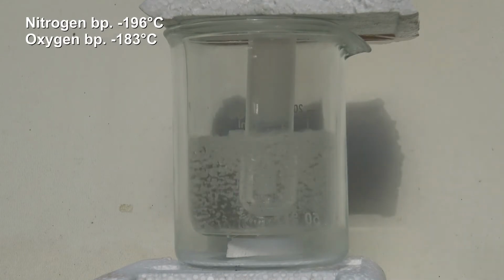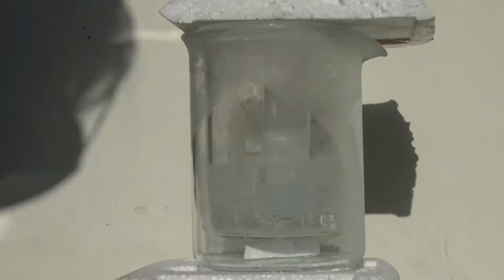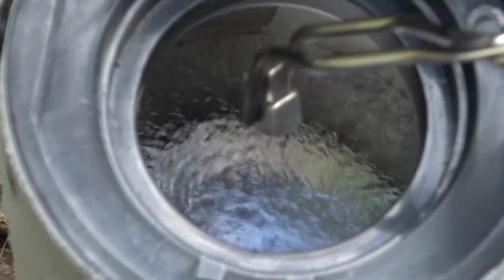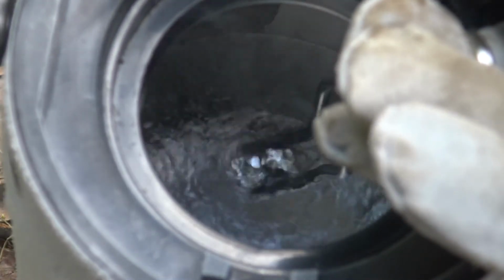To remove ice from the surface of the beakers, it was covered with some ethanol. Liquid oxygen has a pale blue color, which can be seen better when the prepared oxygen is dried before the condensation, as it can be seen here. In the meantime, 2 strong neodymium magnets were also cooled with the liquid nitrogen. Then the oxygen was poured onto the magnets.